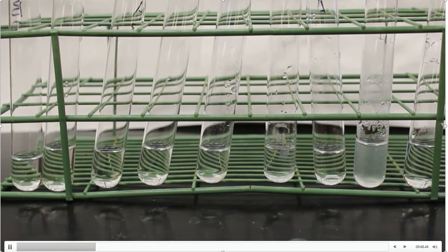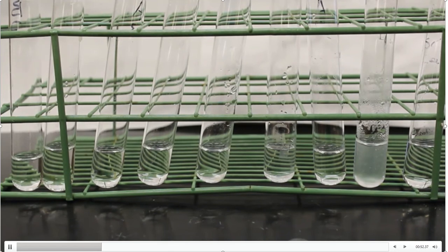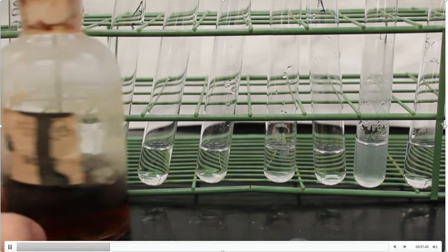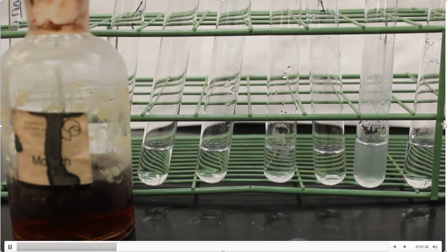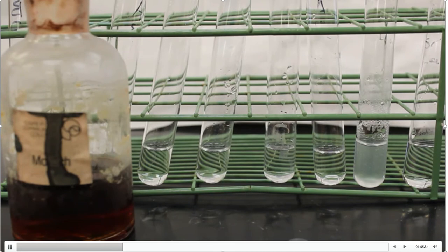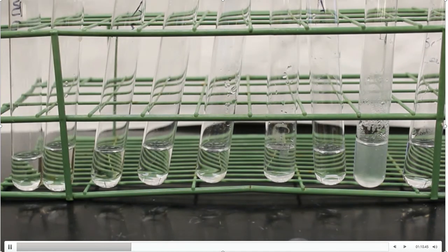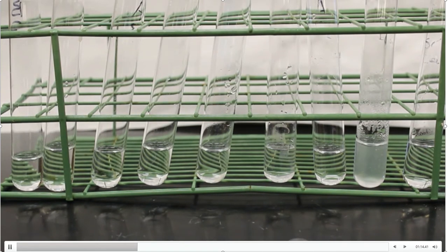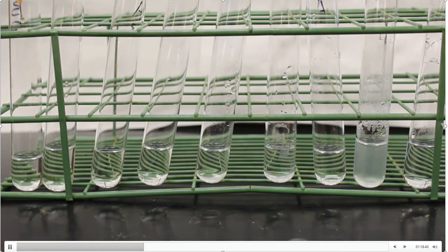So that is the order of the test tubes, so that way you can write down the proper observations under the ones that you actually need. So the first thing we're going to do in the Molisch test: I'm going to take the Molisch reagent — that's what it looks like right there in the jar — and add a couple of drops to each test tube. It's qualitative, folks, that's all that matters.